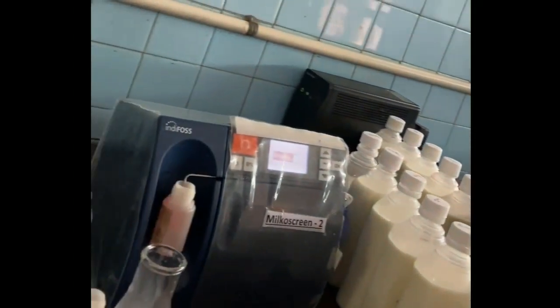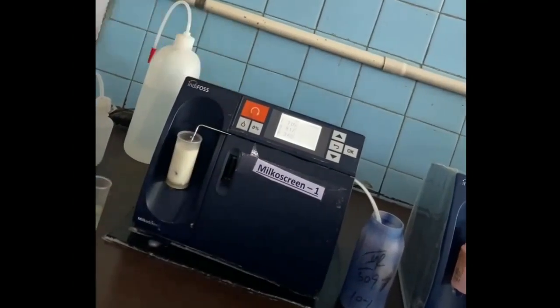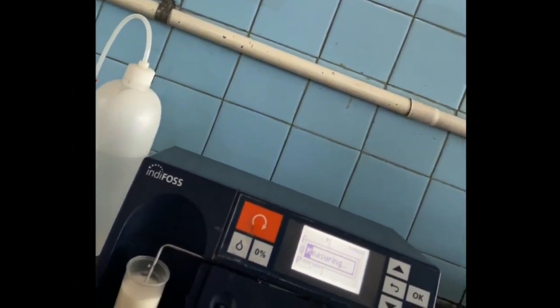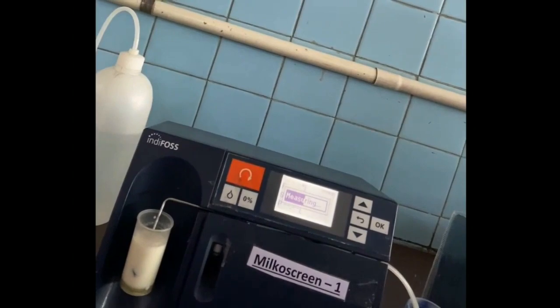These are the various milk samples and this device is called Milko Screen. We are inserting a milk sample, clicking this button, and now it will start measuring. This machine can measure various parameters like adulteration — for example water — or the addition of sugar or starch in milk. This device takes around 40 to 45 seconds to measure the SNF, fat, and protein in milk, and it can also find the adulterants which are added in the milk.